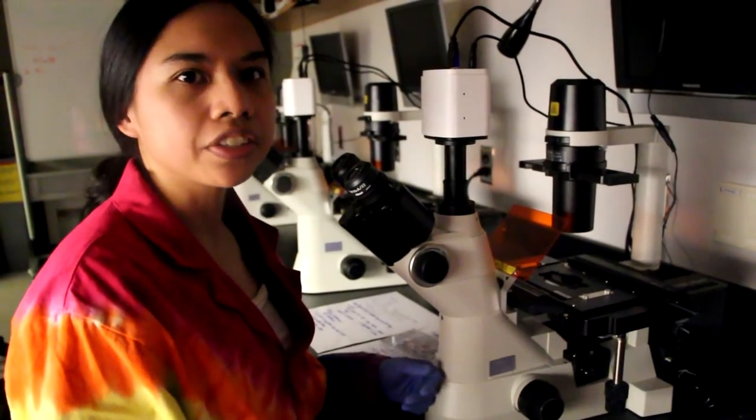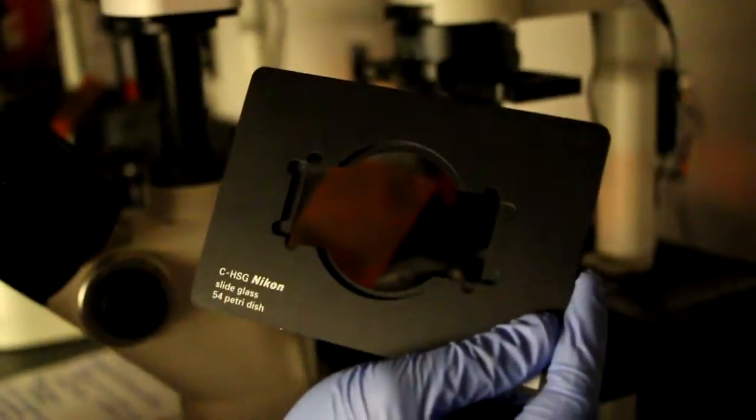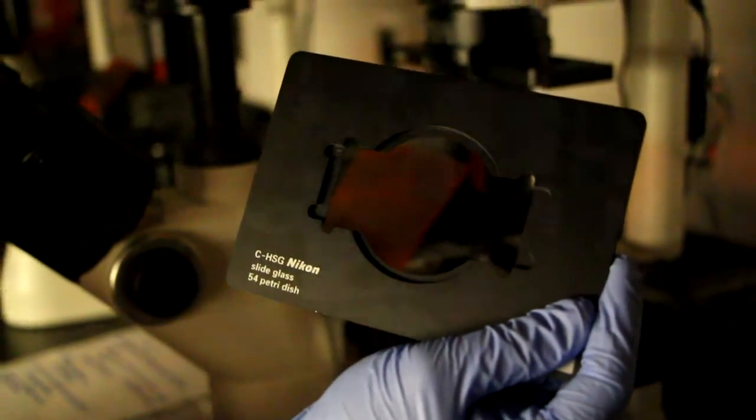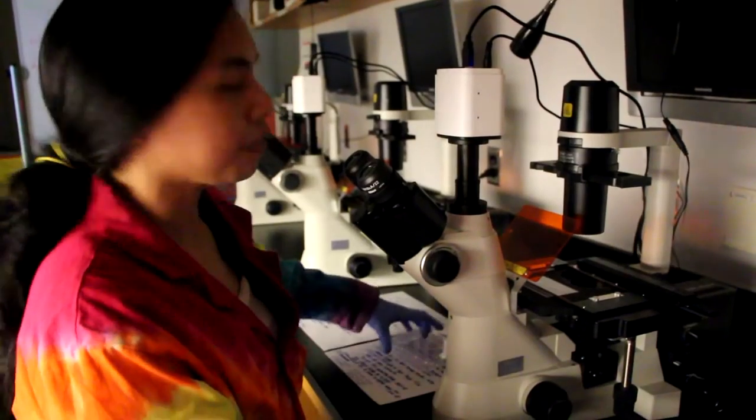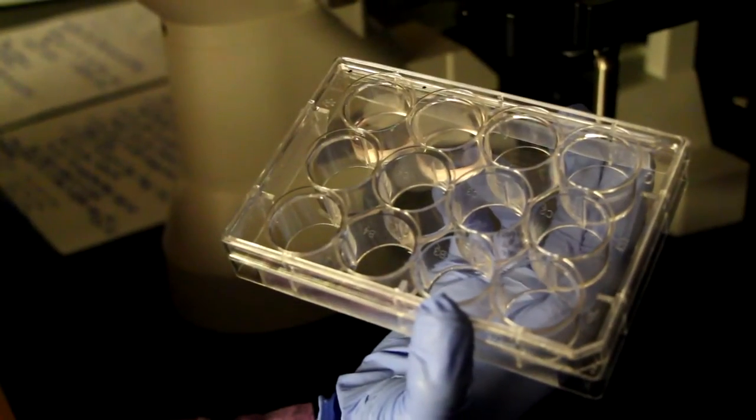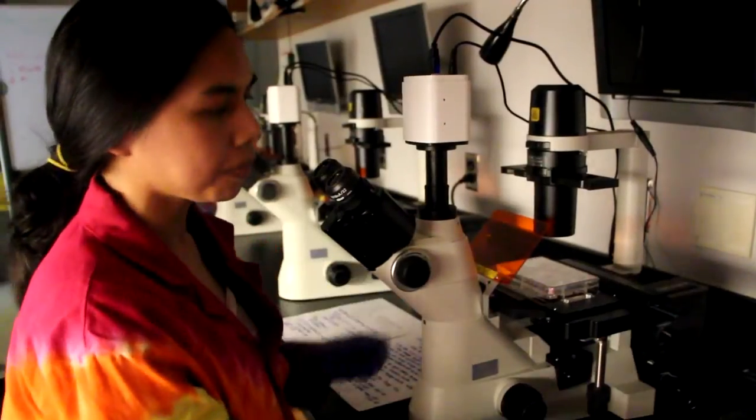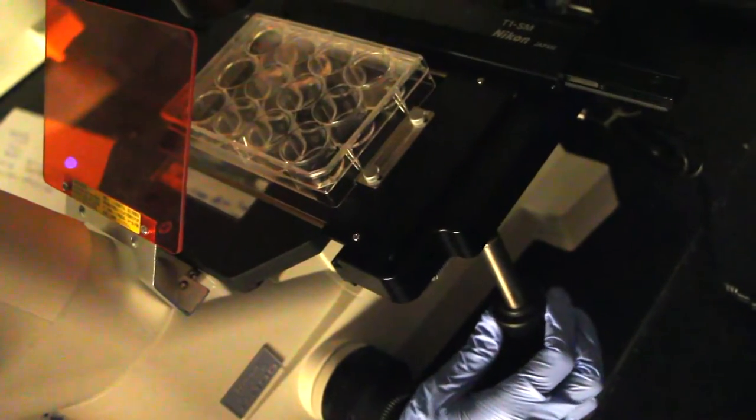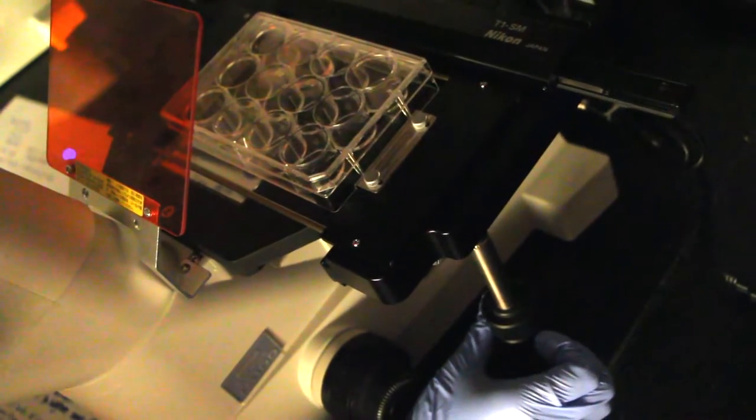The last thing to talk about is the stage. The stage has a slide holder if you are looking at cells that have been mounted on slides. Alternatively, you can take this piece out if you're looking at a plate, like we will be doing today. The plate will fit within this little rectangle, and then we can use this knob over here to move the plate in any direction.